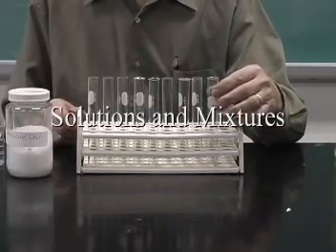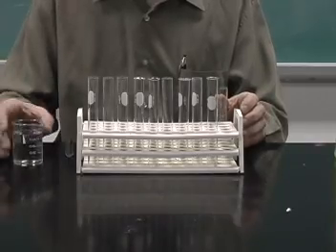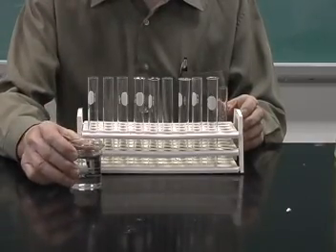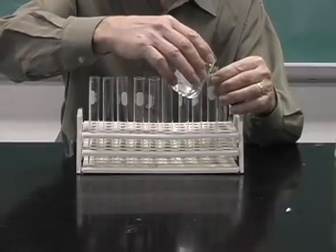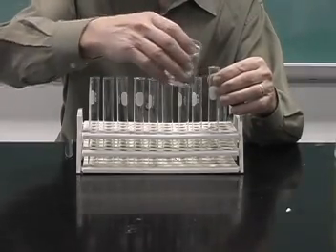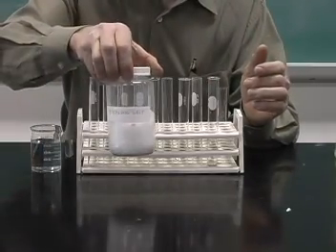To form a solution, you require a solvent and a solute. Now, a common solvent, of course, is water. So I'm going to add some water to a test tube. And then we can add something like pickling salt.